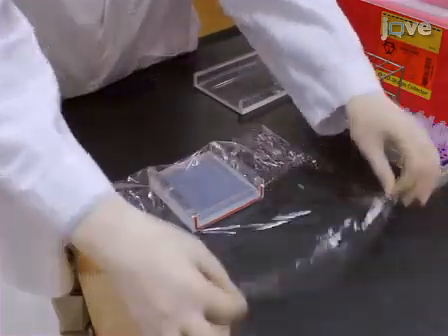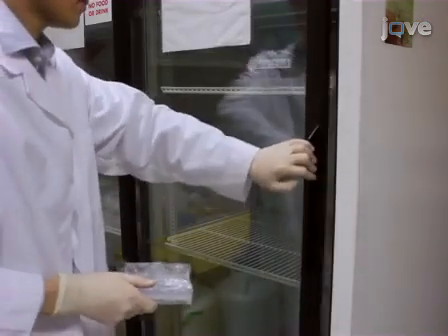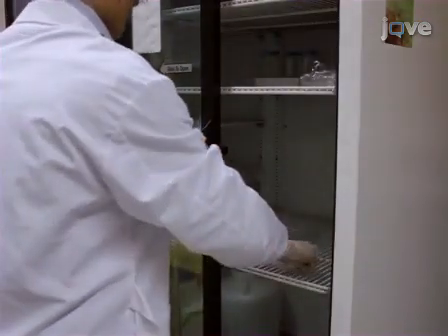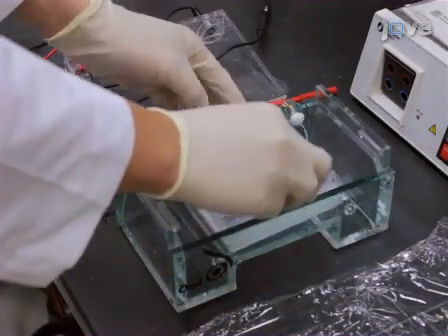If the gel is not going to be used immediately, wrap it in plastic wrap and store at 4 degrees Celsius until use. If the gel is going to be used immediately, place the gel in the gel box.